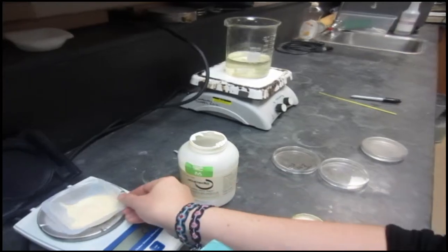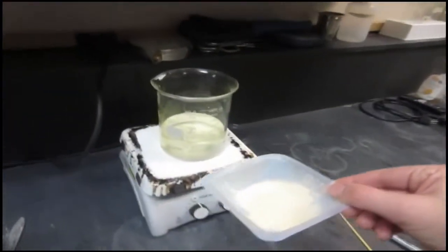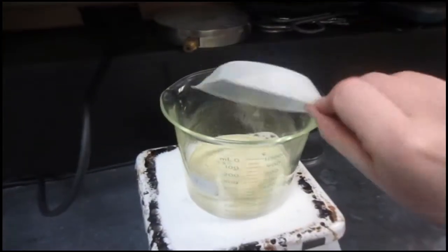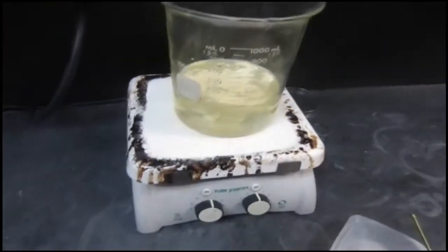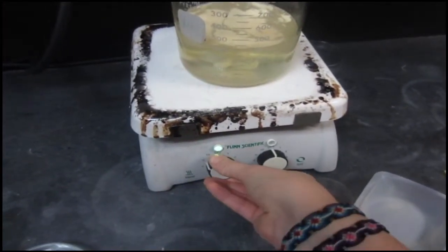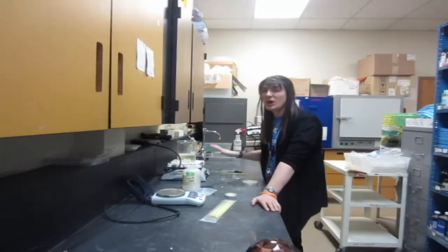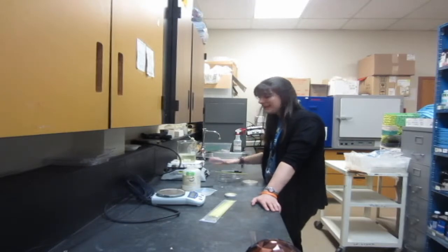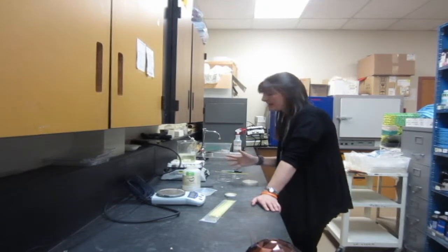Then I'm going to turn on my hot plate. I like to turn it to 9 or 10, pretty hot, but you have to watch this stuff. Agar has to get to the point where it's boiling. But if you leave it boiling too long, it has a tendency to overflow and it smells horrible. So you really have to watch this stuff or it'll make a really big, really smelly mess.